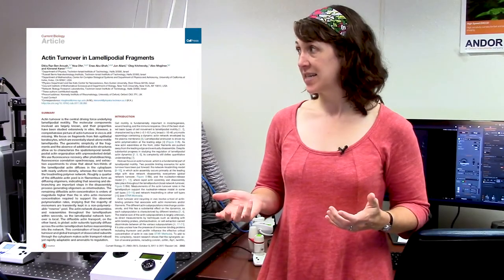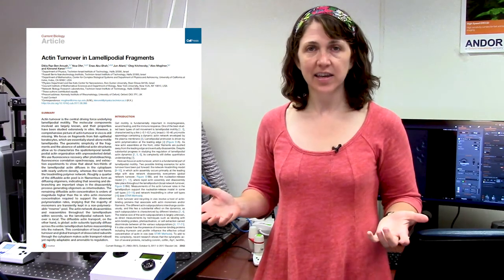In this 2017 paper, scientists used FRAP to study the protein dynamics of actin in living, crawling cells. But to understand the results, you have to understand how FRAP works.